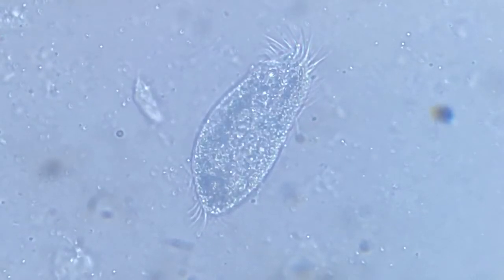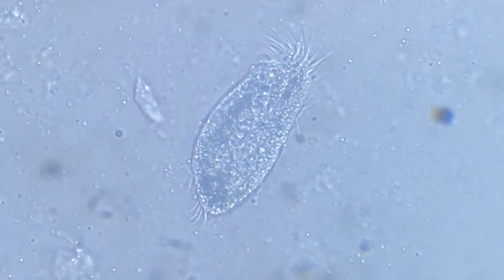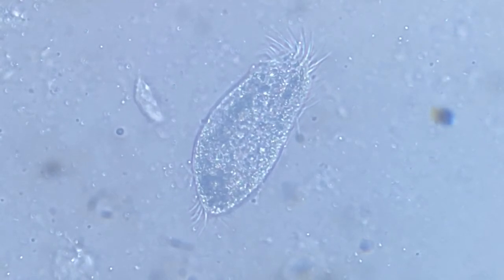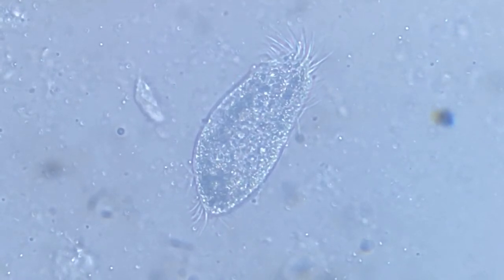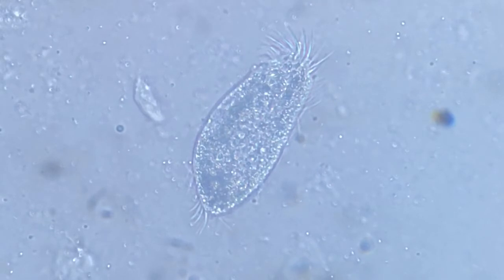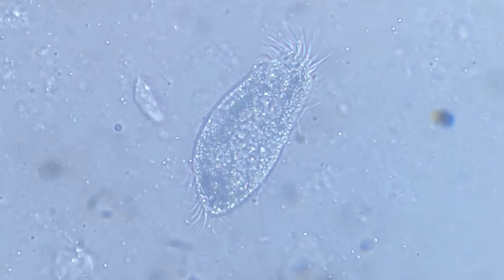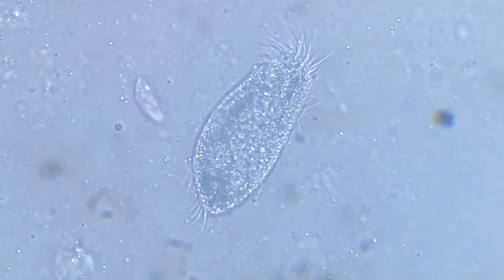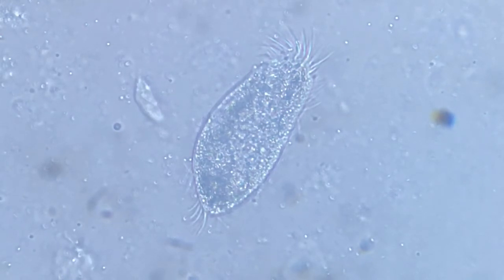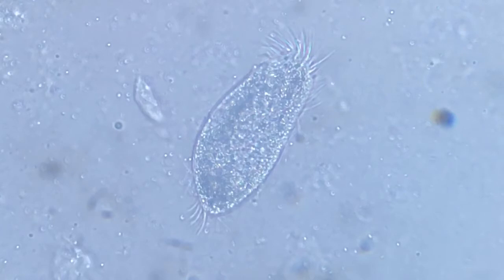It is dead. Water from the surrounding medium will now move inside the body. And since the contractile vacuoles are no longer functioning, the body will be bloated and soon it will rupture.